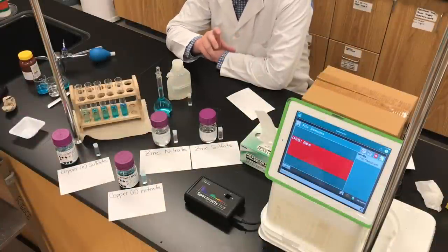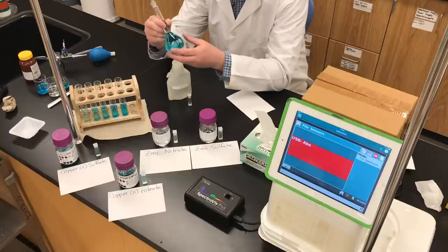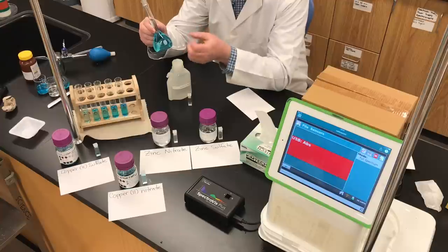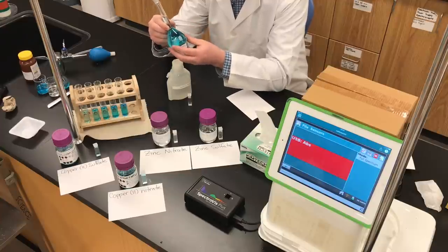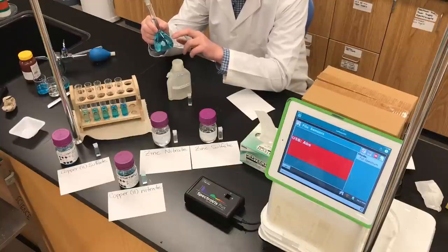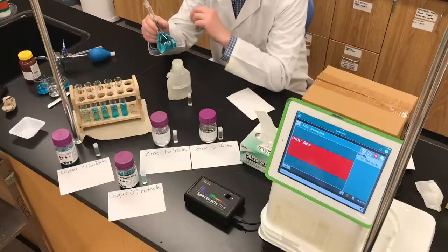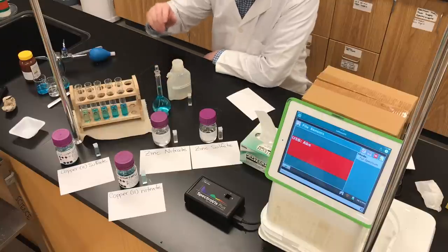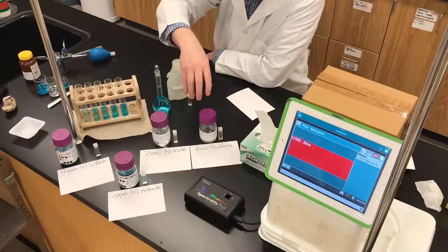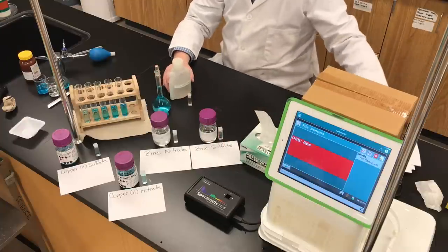Next, we're going to take a look at some absorption spectra. In the 100 mL volumetric flask we have our dissolved brass solution, which contains copper-2+ ions, zinc-2+ ions, and nitrate ions in water. We're going to examine the absorption spectra of copper sulfate, copper nitrate, zinc nitrate, and zinc sulfate to understand which ion is responsible for absorption. But first, let's calibrate our spectrovis spectrophotometer, which can shine light of any wavelength in the visible spectrum through a solution.